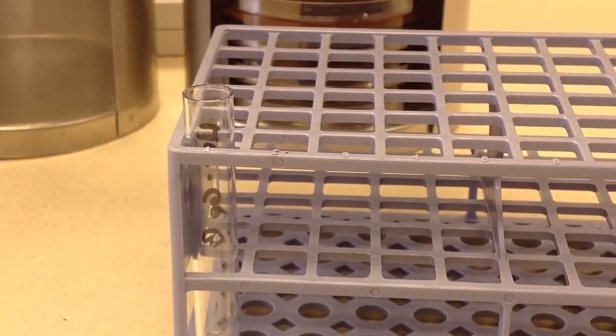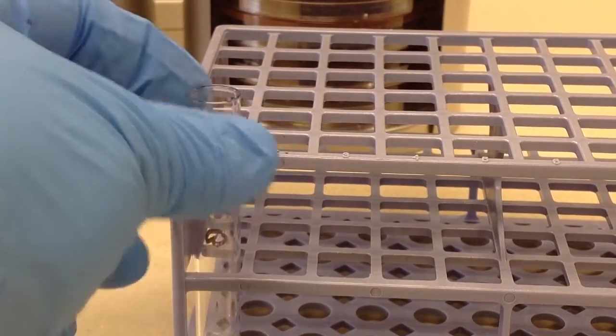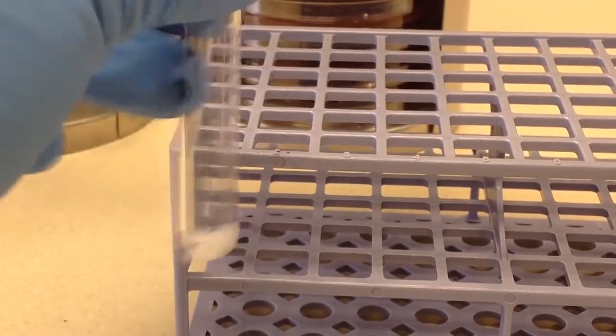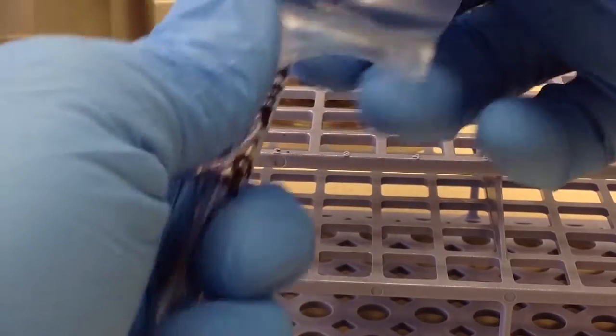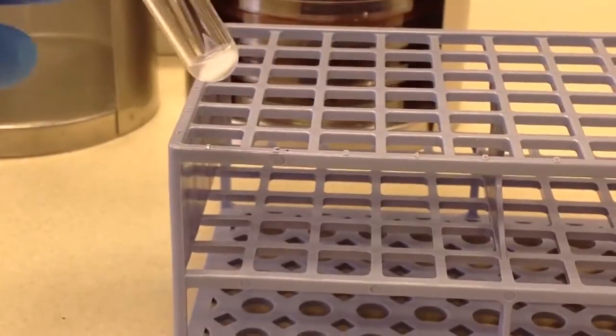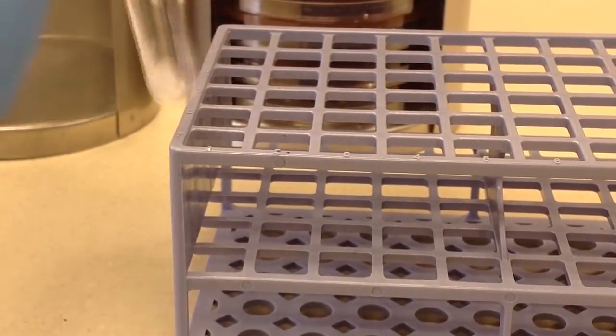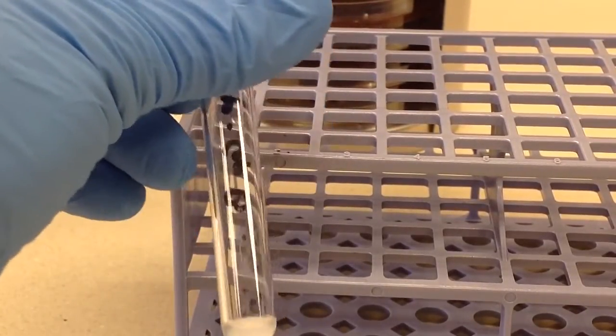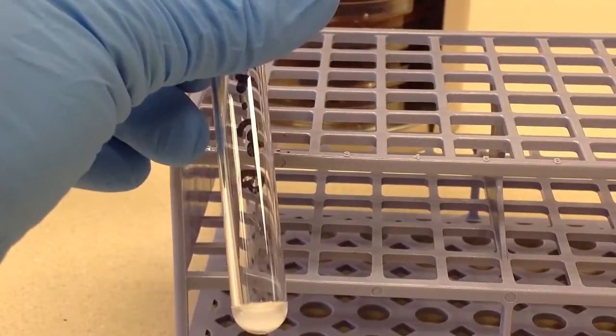Now it calls for a two-hour incubation at 37 degrees, so I'm going to shake that up a bit. I am going to parafilm this just to prevent dehydration of the sample. We'll check this in two hours.